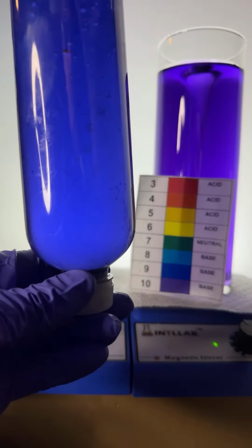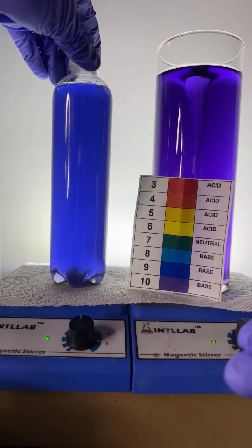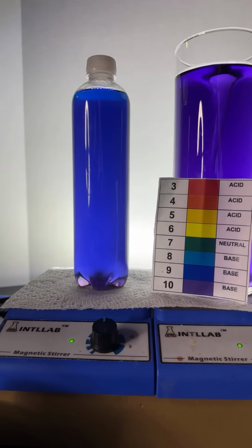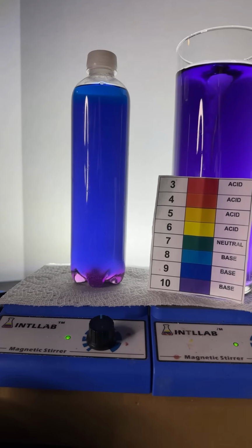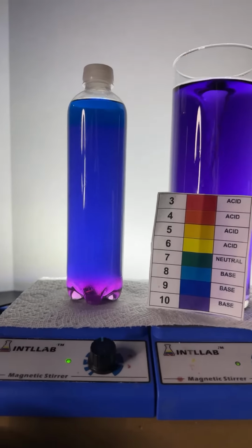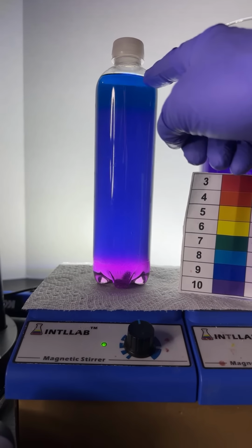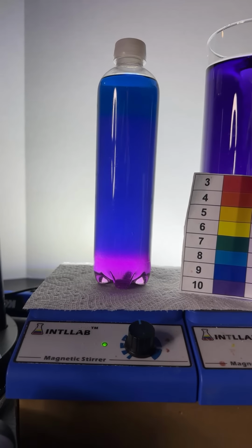All right, let's see what happens now. This is when things get really interesting. Come on now. This is where it gets really interesting. I love it too, Saint. Thank you there, King Roy. Come on now. What the heck is going on? What is even happening? We got a blue layer on top. We got a violet layer on bottom. What gives? What in the world is going on?